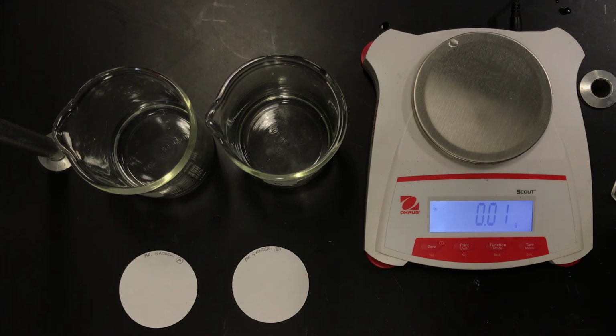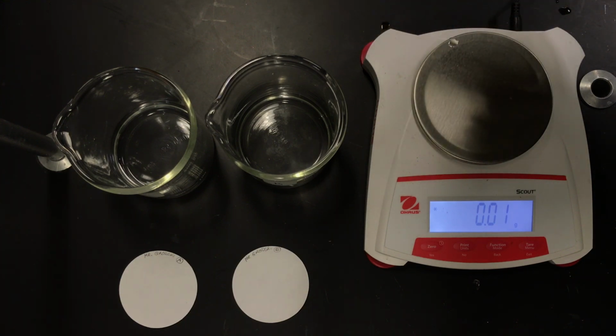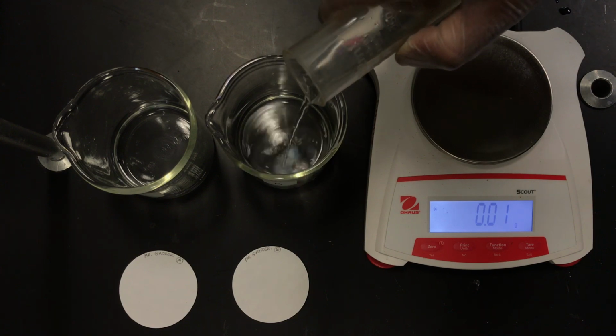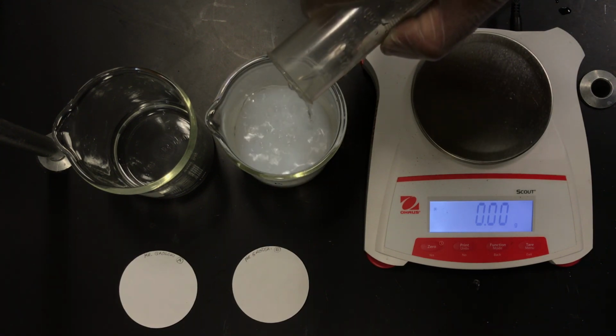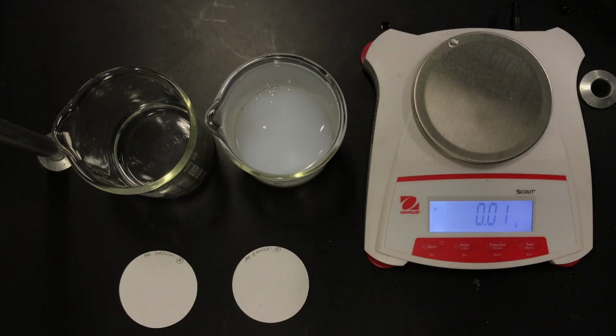So it's really the calcium +2 that's going to find the carbonate -2, and those have 2 high charges, and those are going to make a precipitate. And so as I add the calcium chloride, and I'm adding excess amount of the 0.2 molar, we should see a precipitate form. And there it is. Again, I'm adding excess, so I had to at least add 125 milliliters here.